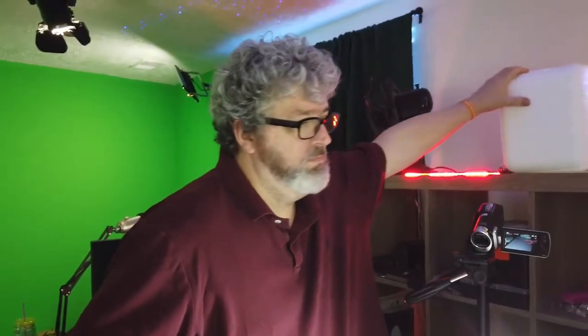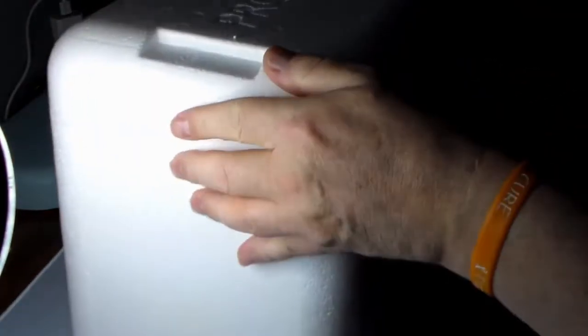So what I did is I went online and learned how to build my own incubator. Most instructions said use a box, like a cardboard box. Some said styrofoam, and I didn't have a styrofoam cooler. However, my girlfriend got a shipment of her medicine today. Her medicine has to stay cool. And in that box was this styrofoam container, which is going to become an incubator.